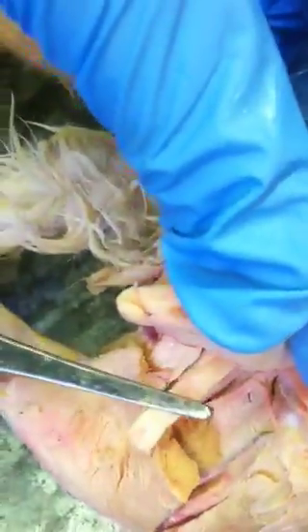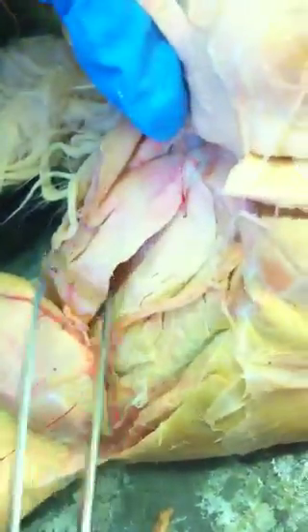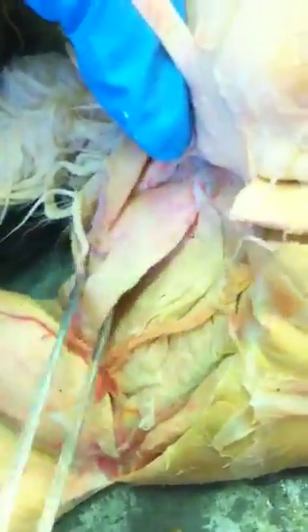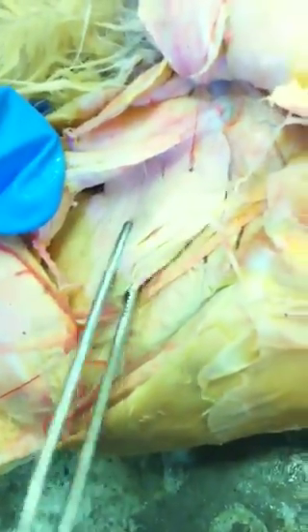And then when we reflect it, this piece here is the abductor cruris caudalis. It runs along with the sciatic nerve. And then this muscle here is the semimembranosus. On this side we can also see the adductor magnus.